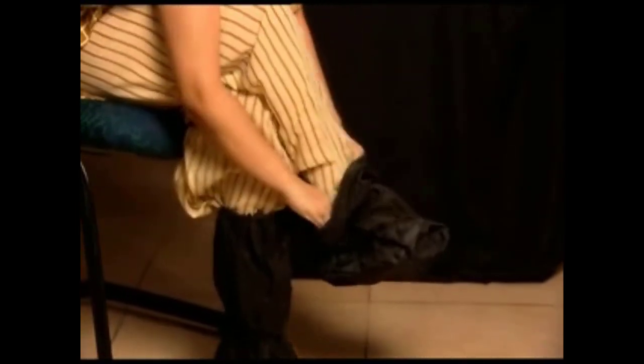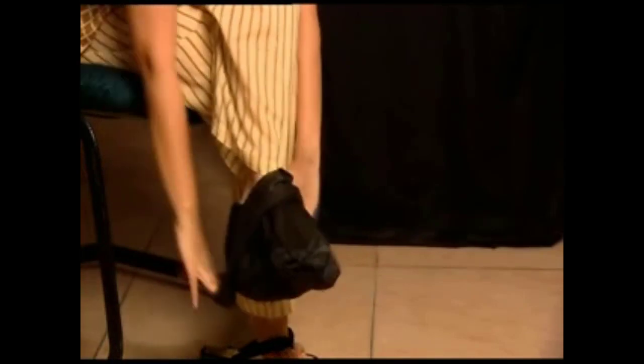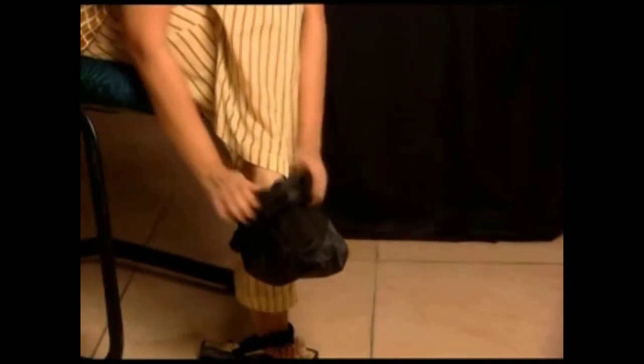Undo the velcro lock and discard the protective headgear. Slide your fingers beneath the elastic into the non-contaminated area of the shoe cover and roll them down as you take them off.